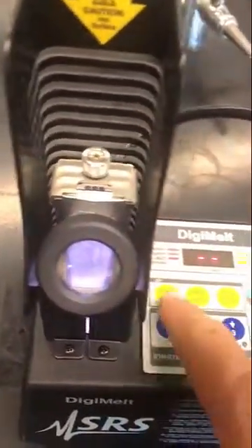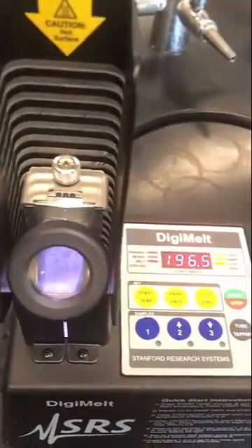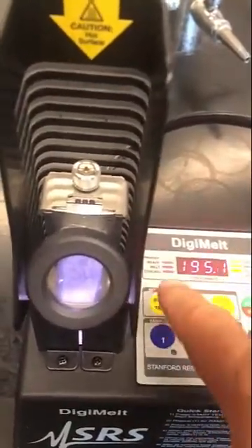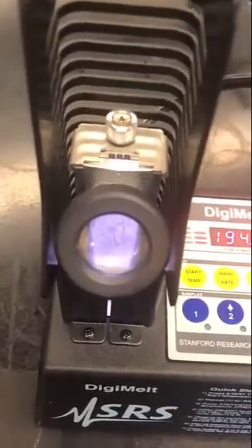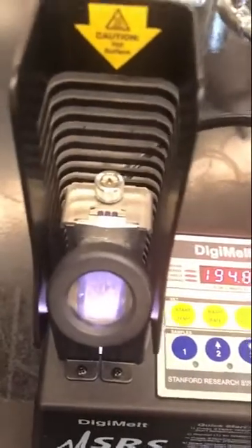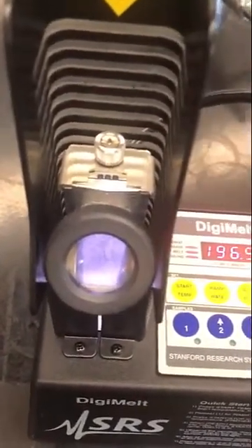Now that I've done that, I can look at my start temp and hit that again — that's where the temperature actually is right now. If you wanted to do another run, you could click that button, it would preheat and get to the starting temperature. You could pull the old samples out — we never reuse the melting point samples — put new ones in, and throw the old ones either in a solid waste container or in the broken glass container.